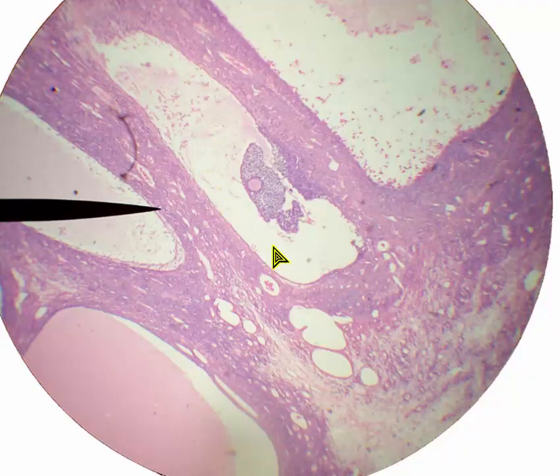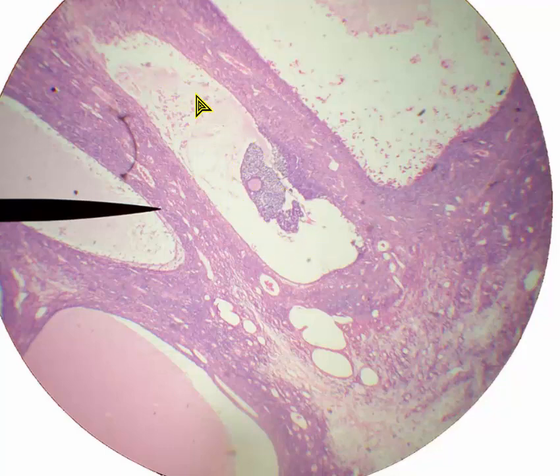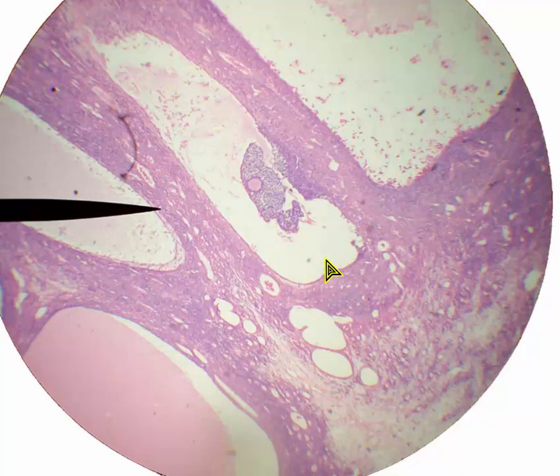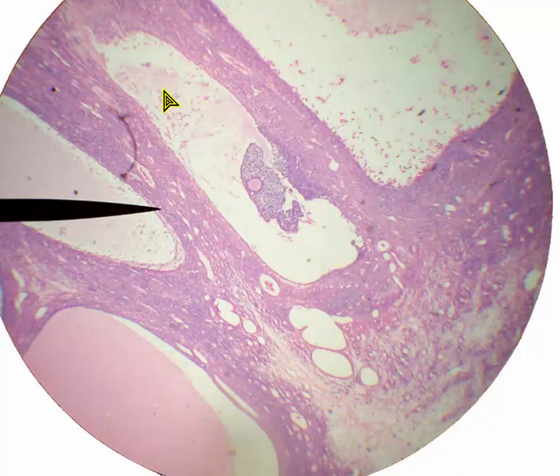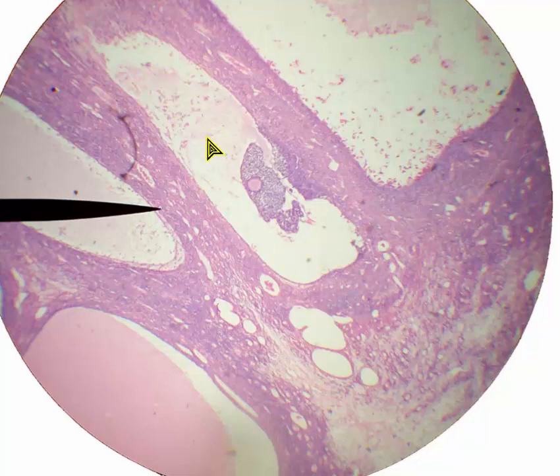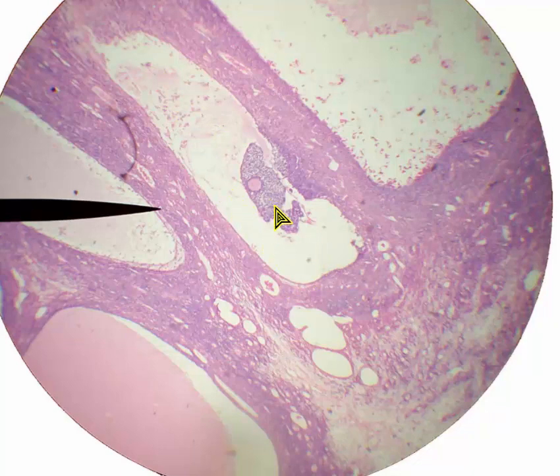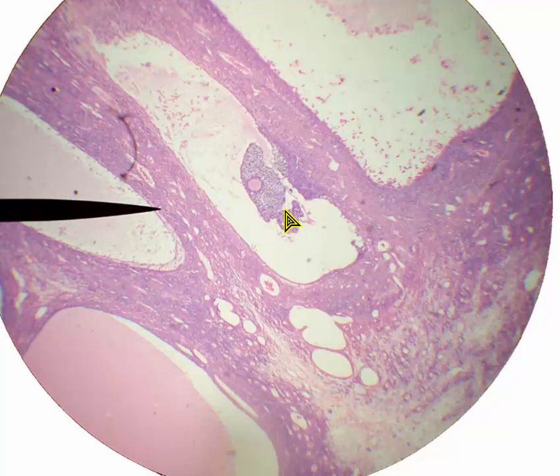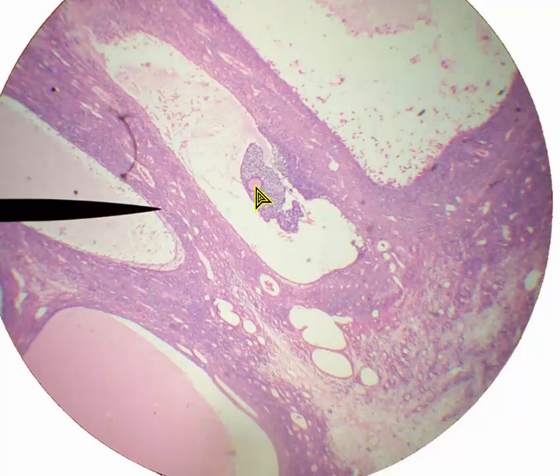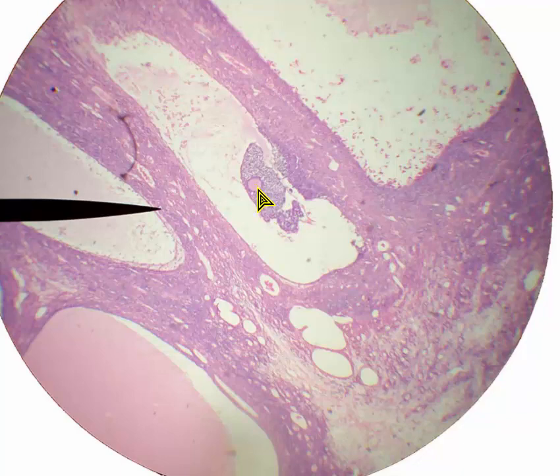One more — if I put the pointer on this entire structure and said name it, the answer is Graafian follicle. The way you know it's a Graafian follicle is it has this big fluid-filled space. I could also ask about these cells, which again would be granulosa cells or follicular cells, or name the cell in the center, which again would be oocyte or egg.